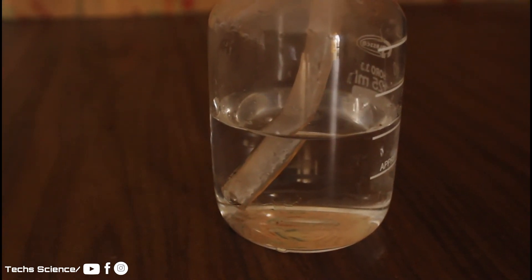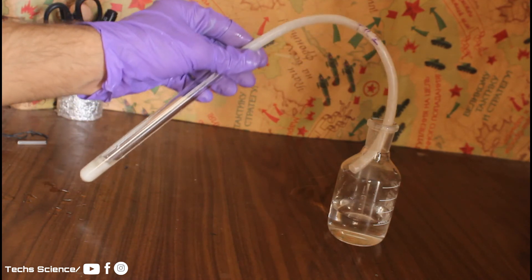After a few minutes, the bubbles stop. Let's see what we got.